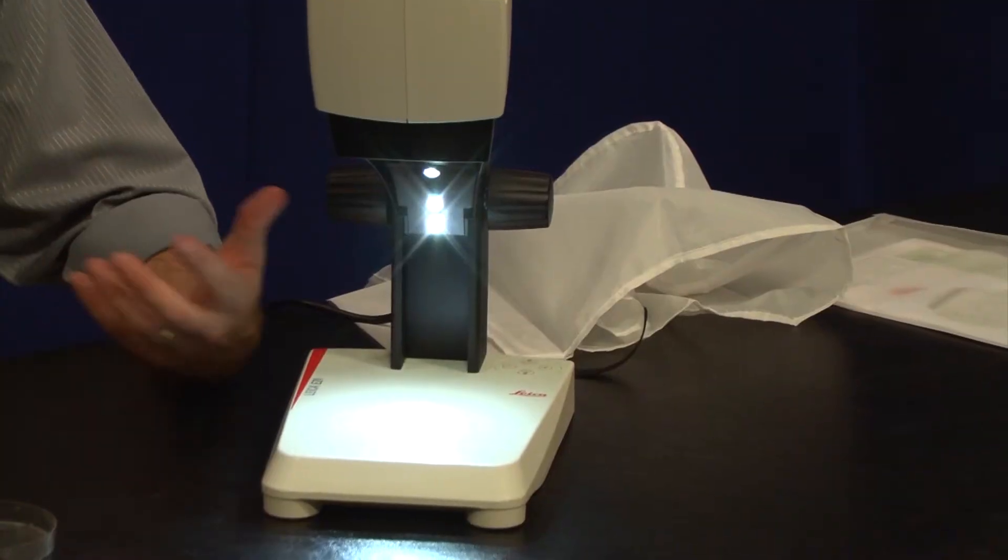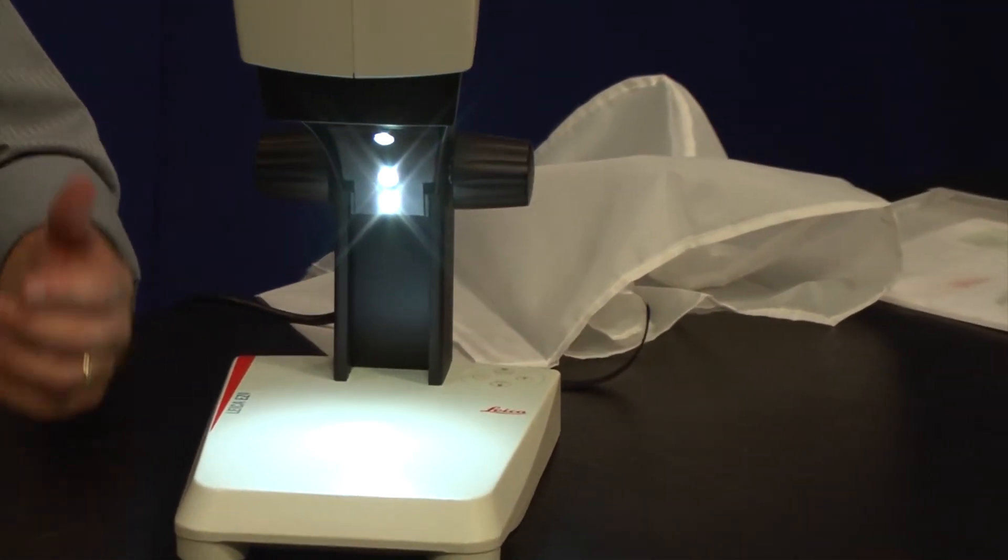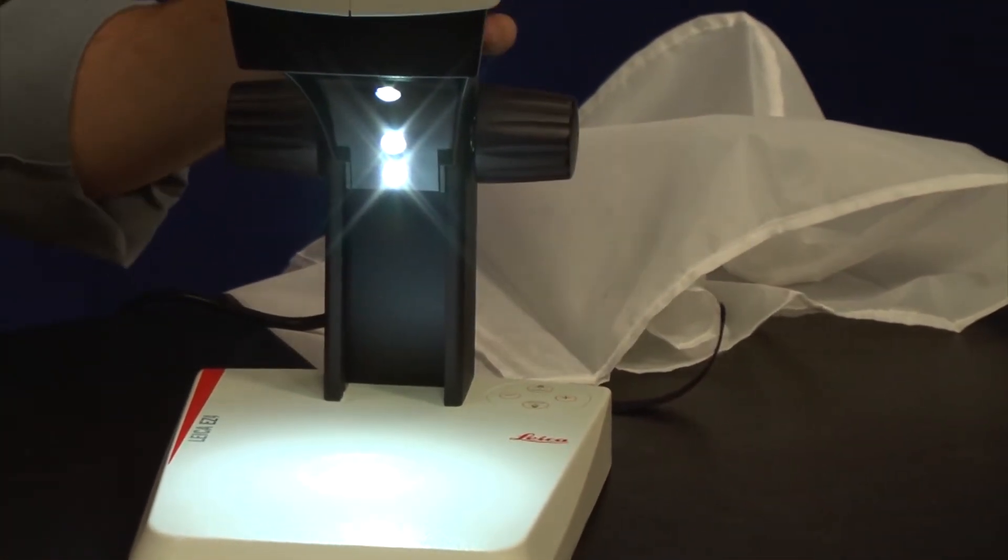In unique cases, we can have the top lights on and the transmitted light on as well. They're not exclusive. You can turn on all the lights if you want, and I encourage you to play with this. Every time you put a sample on there, try different techniques because sometimes what works well for one sample may or may not work very well for the next.